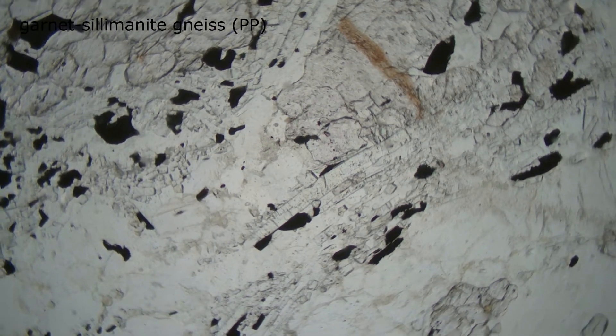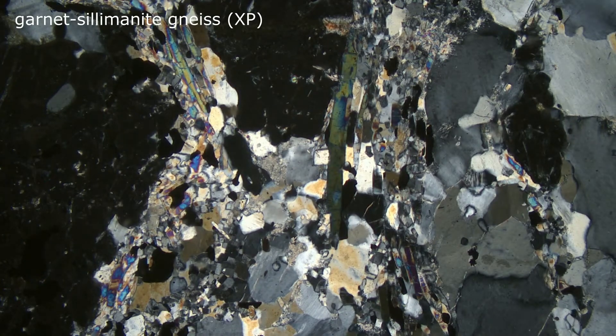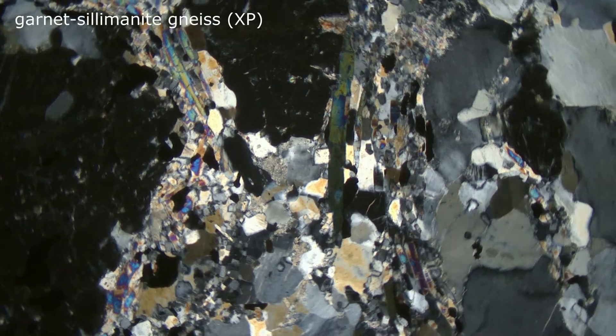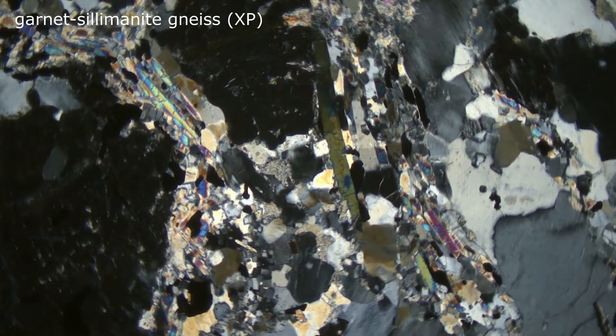As we rotate the stage, we don't see any changes. The uncolored minerals remain uncolored and are not particularly exciting. But when we insert the upper polarizer, things come alive.